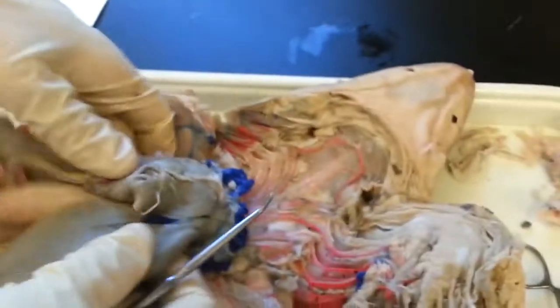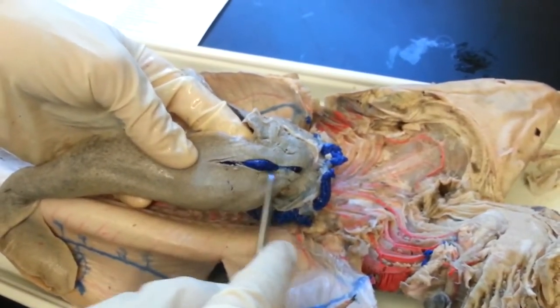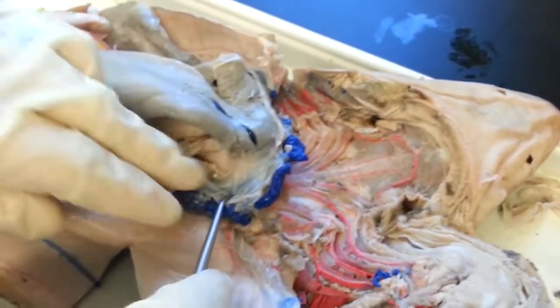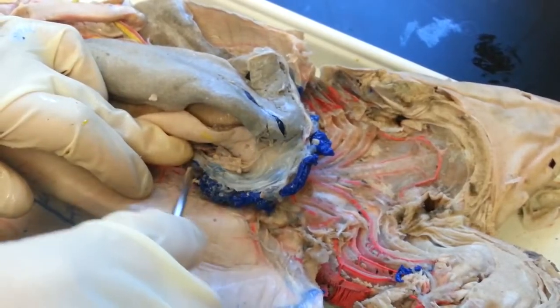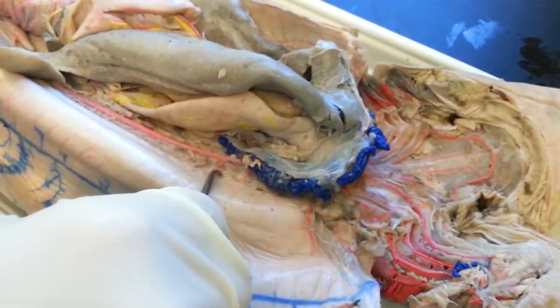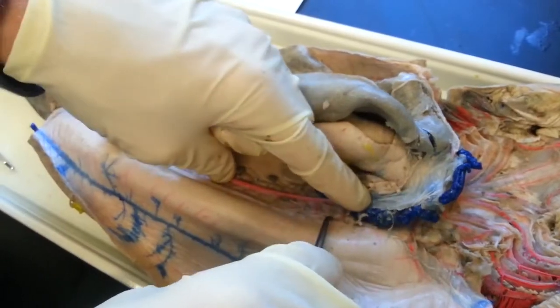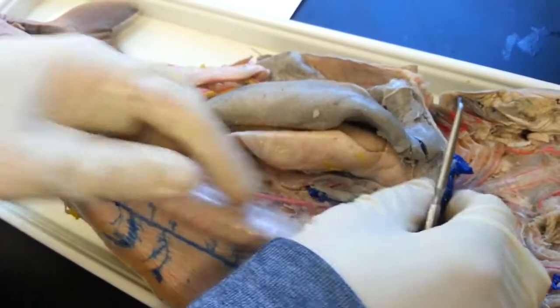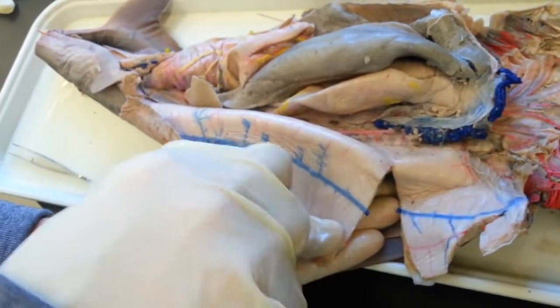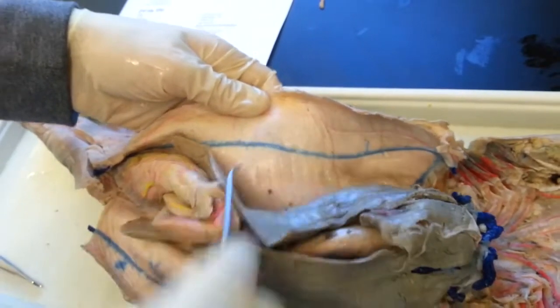Then we have the systemic veins — these are all the veins right before going up into the heart. You have the hepatic sinus in the liver, and then the common cardinal vein where it all comes together. Going off the side of that is the posterior cardinal vein, and coming from the kidneys into that would be the efferent renal veins — those run along the dorsal surface into the posterior cardinal vein. The most obvious one running down the side is the lateral abdominal vein, visible on both sides. That's all the veins and arteries you need to know in the shark.